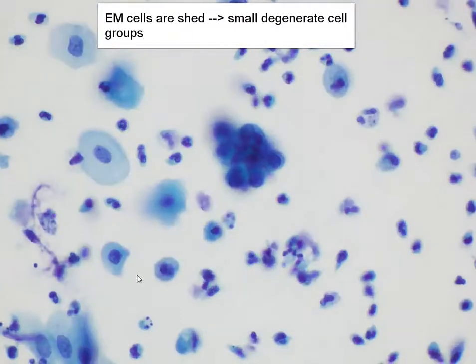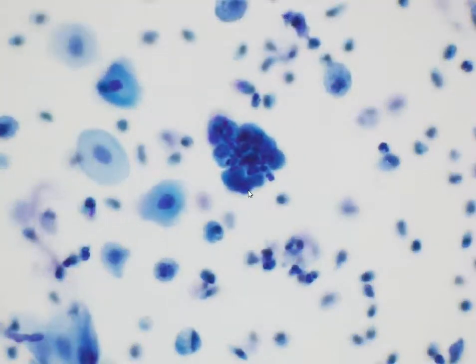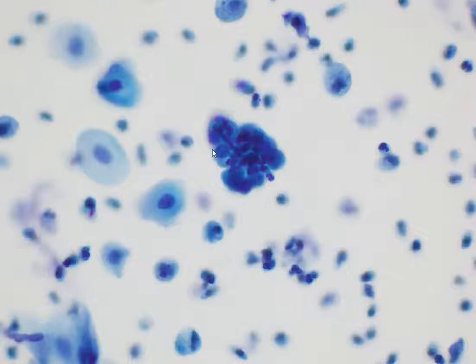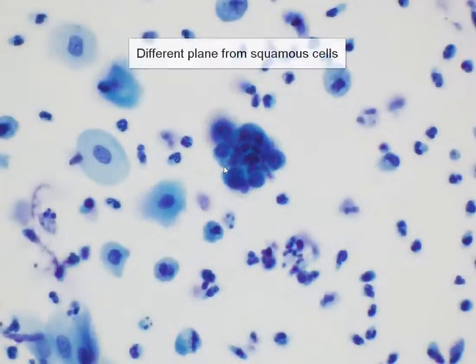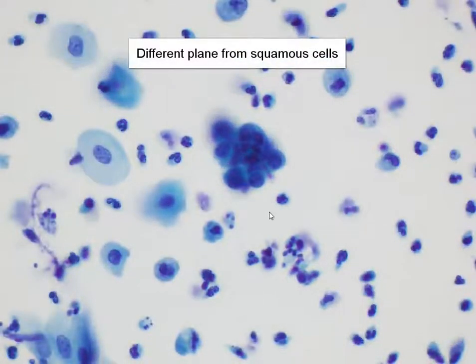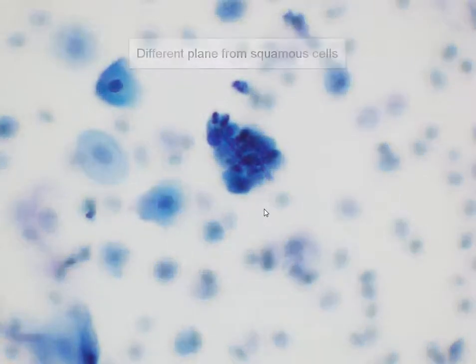Let's take a closer look. When we focus up and down, we appreciate that this cell group seems to be slightly in a different plane of focus from the squamous cells, and that is yet another feature of endometrial cells.